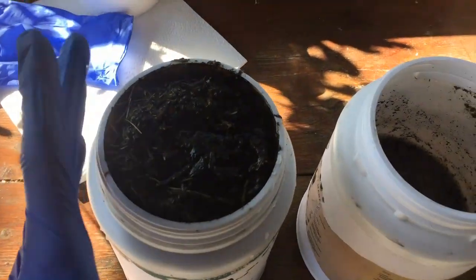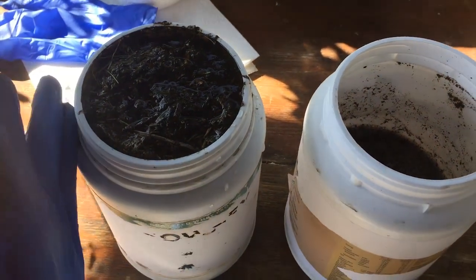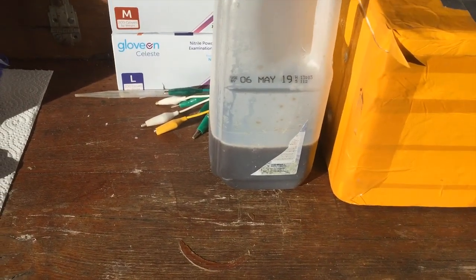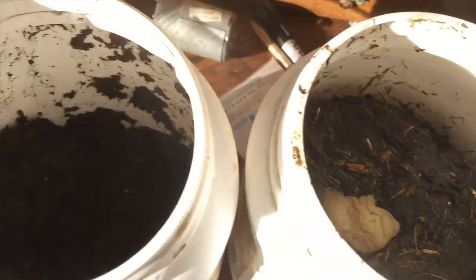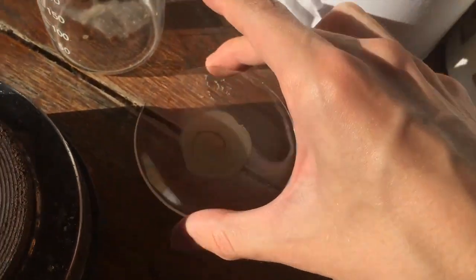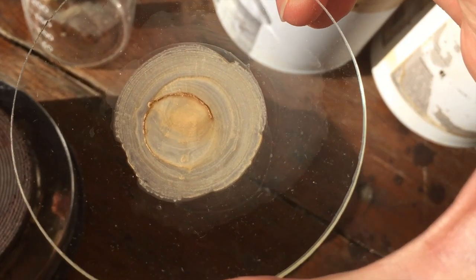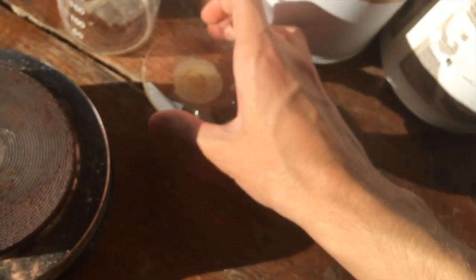We're back the next day. All of the solubles content in the compost and the potting mix should have dissolved, so we'll filter all that out and we should be left with our solution of all the soluble content of both of these. That is our solution containing all of the soluble stuff from our grass clippings. I took a couple of drops and put them on a watch glass — there are a couple of little needle-shaped crystals around the edge of where the water's evaporated, which is a good sign that there are nitrates present. So that's pretty promising.